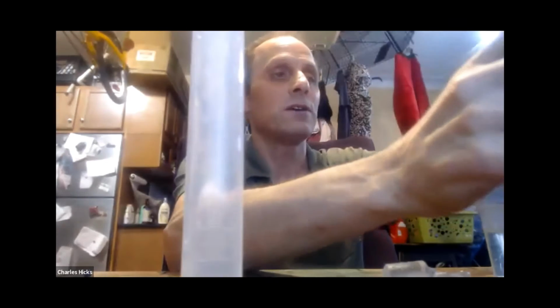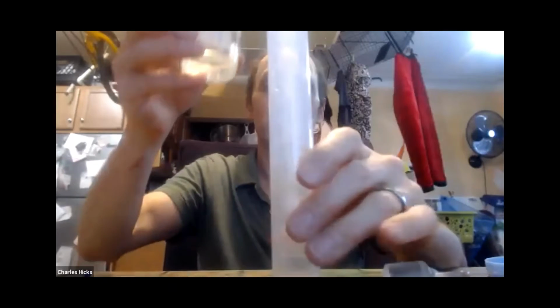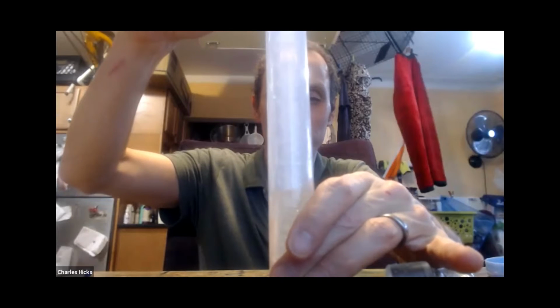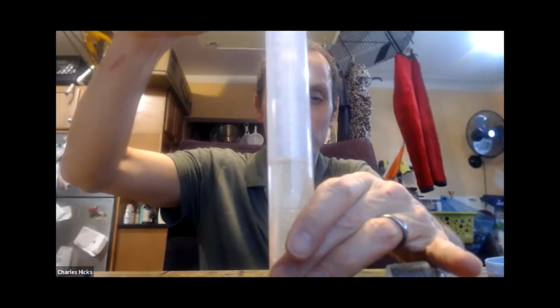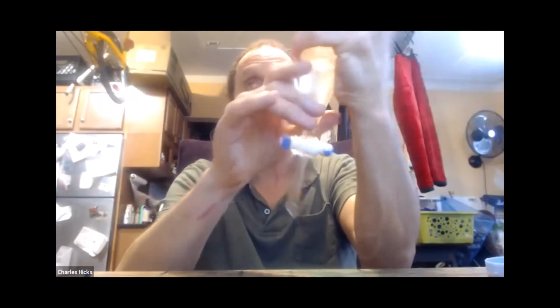It's a good idea to have a container like a large mug or a pot around to stand the separatory funnel up, like you see me doing there. All right, and that's about 50 milliliters of canola oil. You guys can be doing 100 milliliters of each. And we'll do what people often do with separatory funnels: put the stopper on and give it a good shaking. You should shake for several minutes, so I'm going to pause the video while I do that.